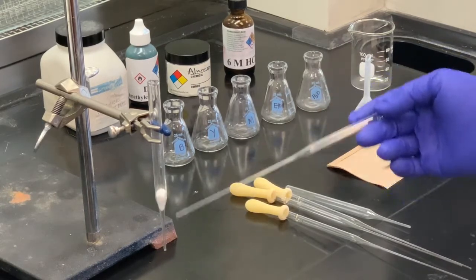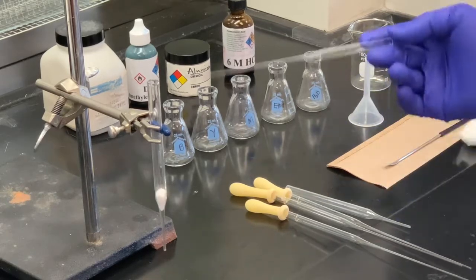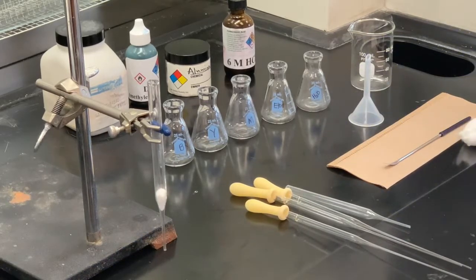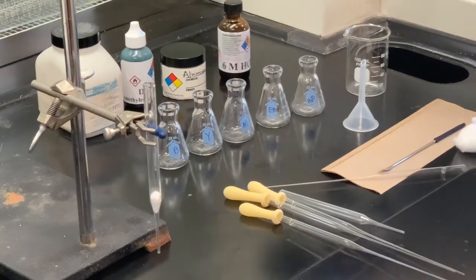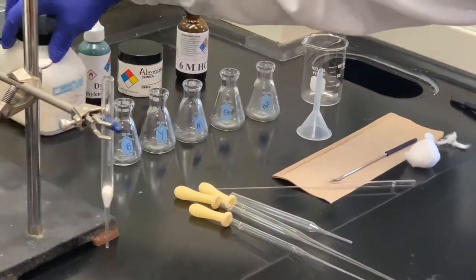If you don't use enough, then you'll have sand and the silica to go through, which again will affect your separation. So once that is done, I'm going to add a little bit of sand.